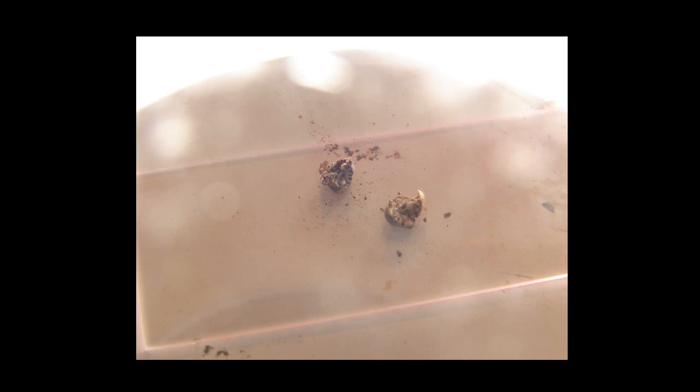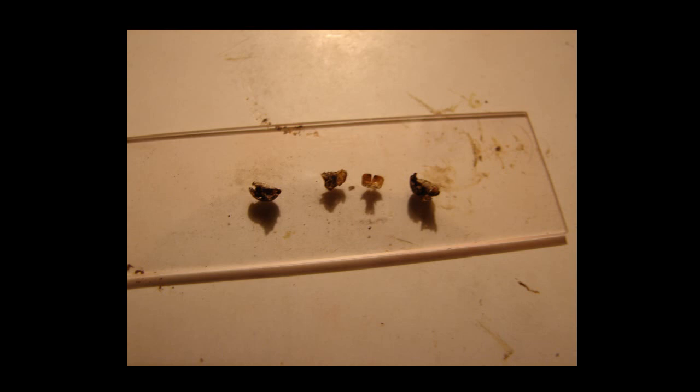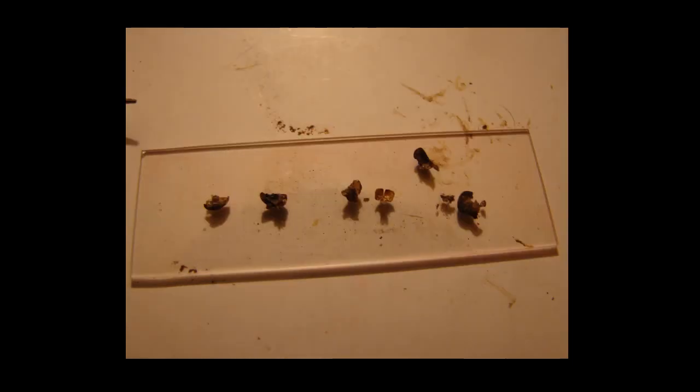I cut it right in between the eyes, then separated the mouth parts and the two hemispheres of the head, followed it up by separating the eyes, the interior tissue, and the mouth parts.